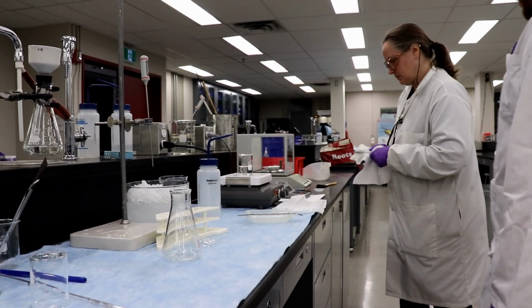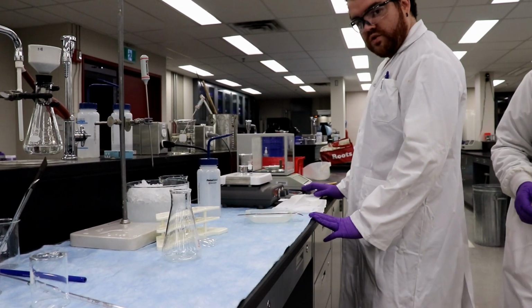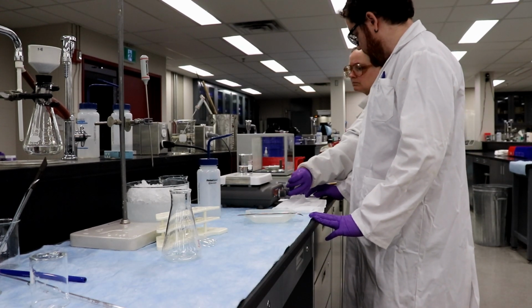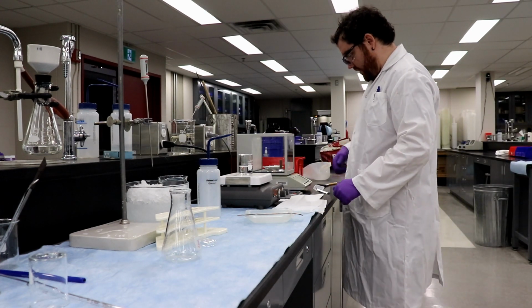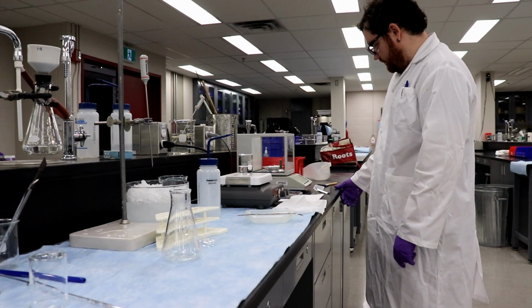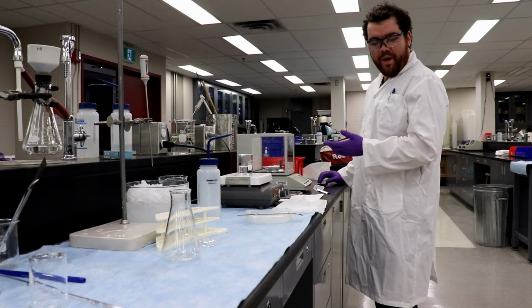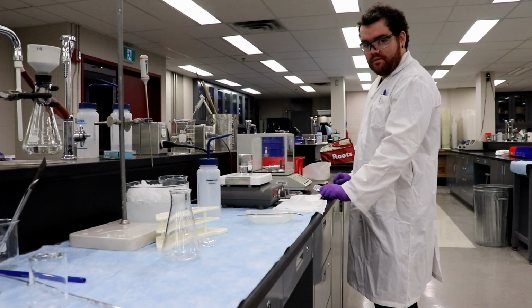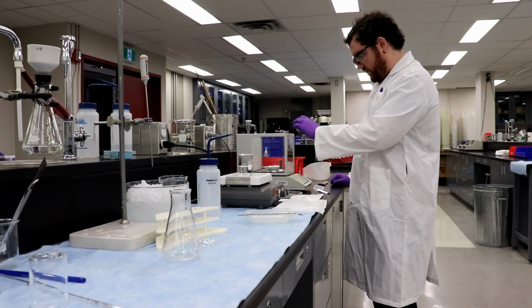Okay, and we're back. It's been about 20 minutes or so of it sitting in the oven, and we're just weighing out the dried product right now. We'll wait for this to settle 2 seconds. Sometimes with fine powders, it takes a little while for the weights to settle because there's so many different types of electrostatic things going on in there. But I think it's slowing down soon.